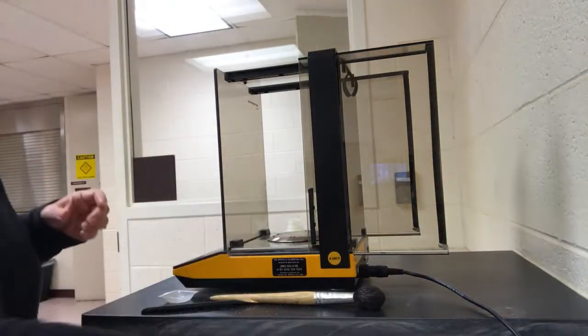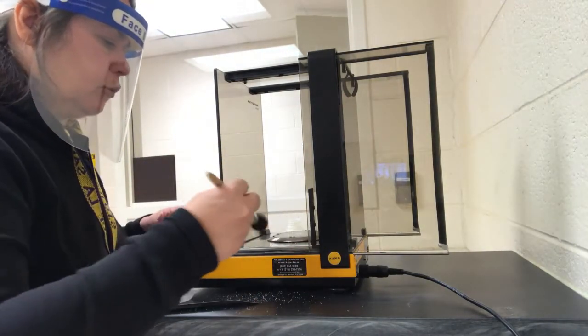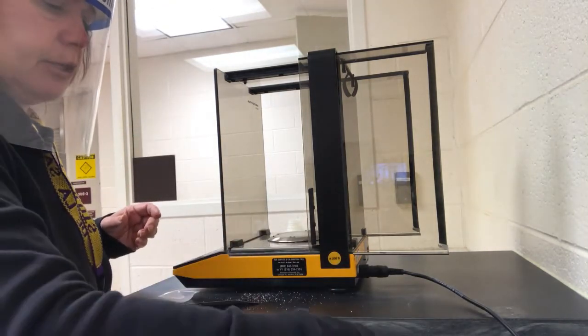Okay, so for being super careful, we would rinse the paper with some distilled water to make sure it all got in there. But we're going to be okay, I think. Looks like I did pretty well. I don't see any left on the balance. A little bit had spilled from the earlier, but I don't think that mass was measured, so it should be good.